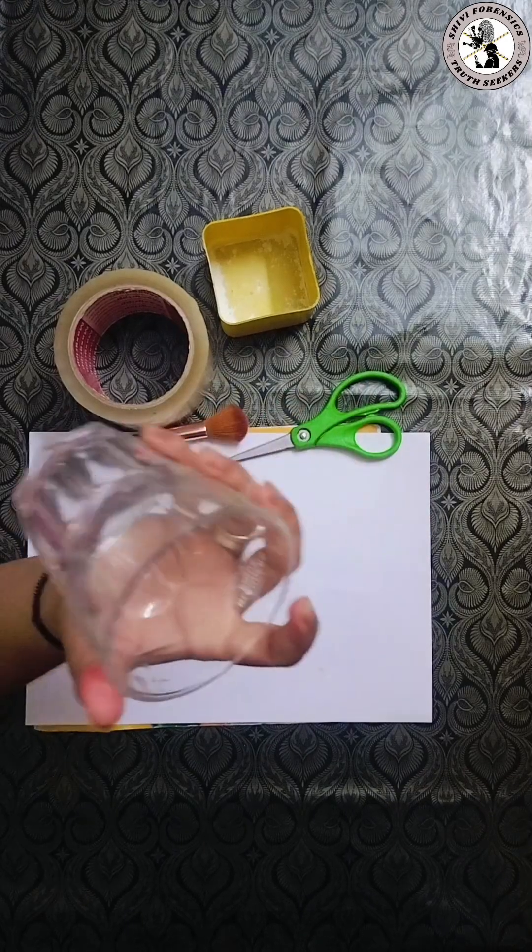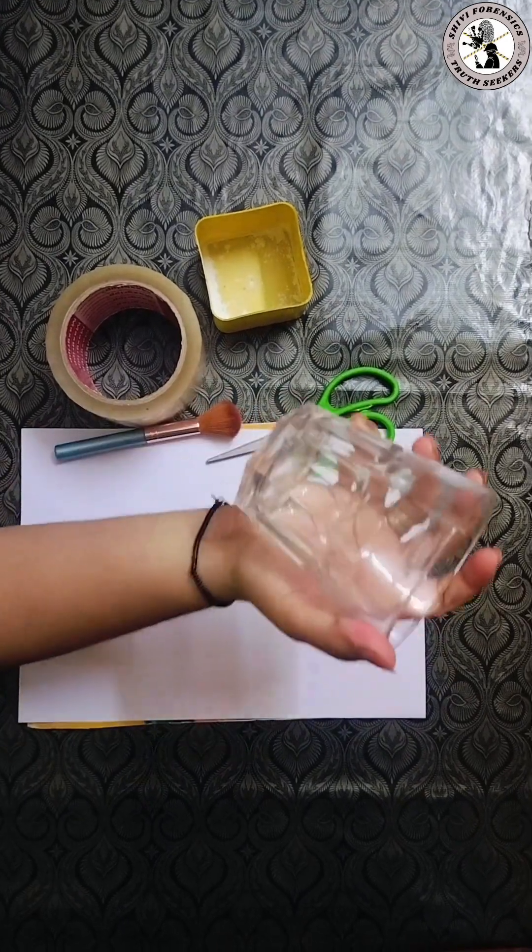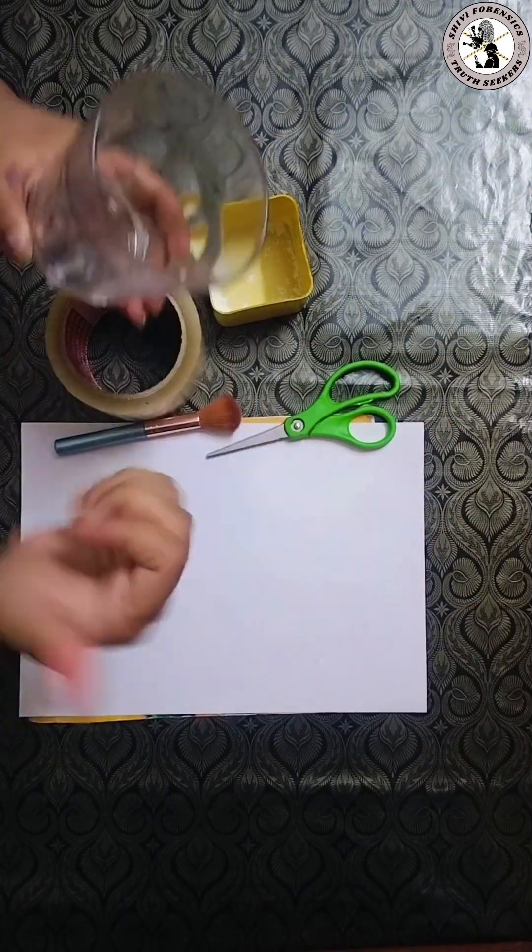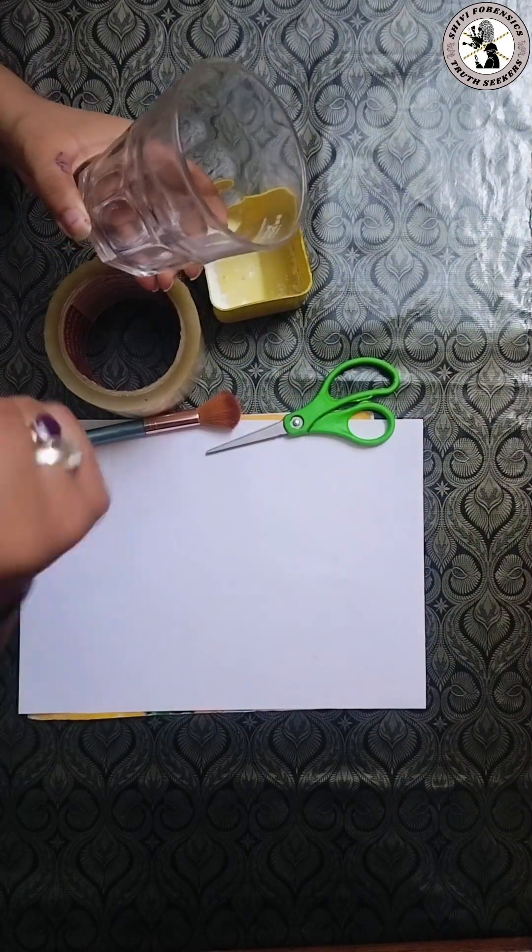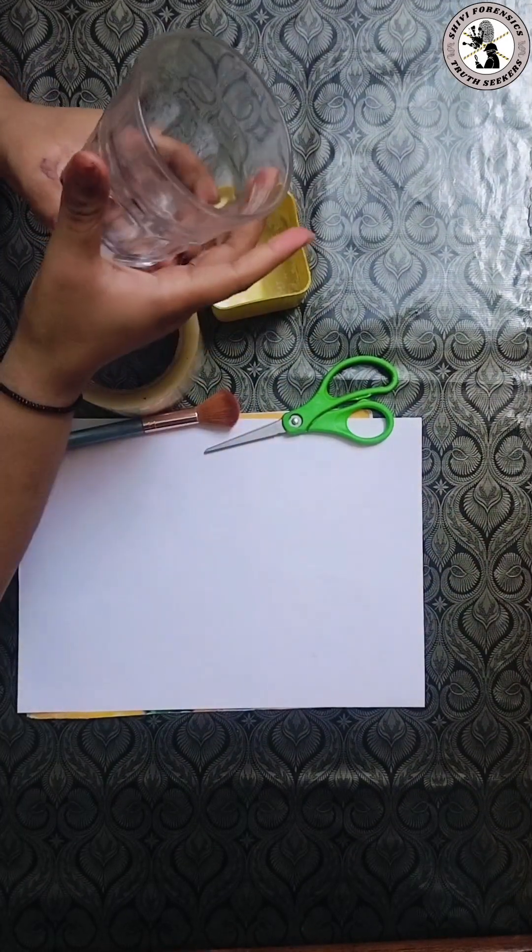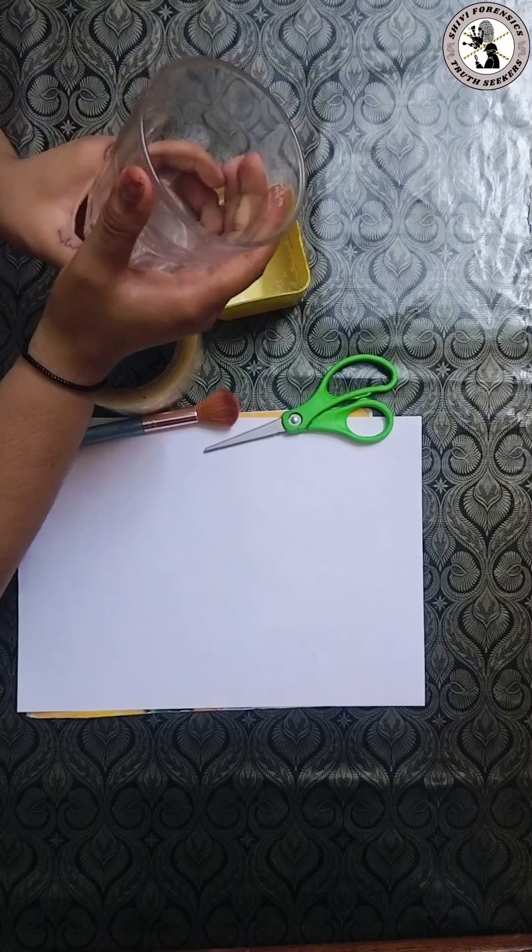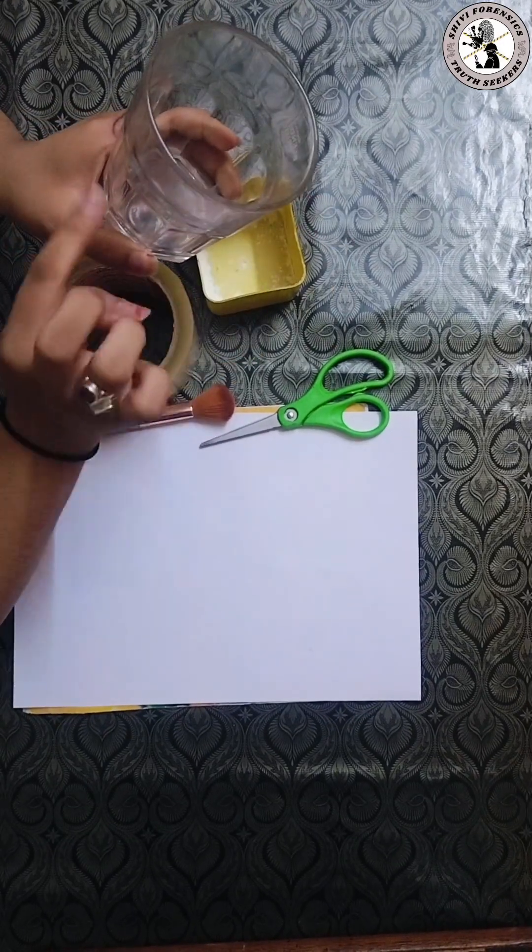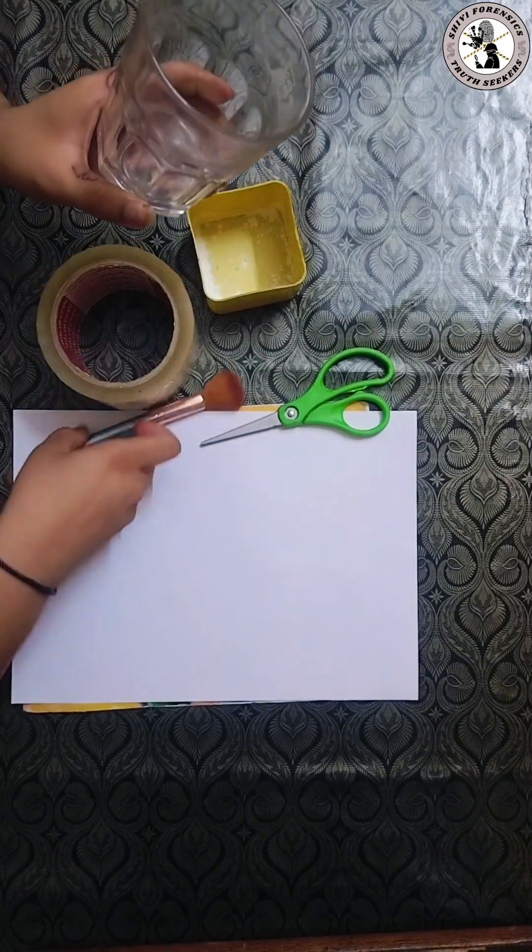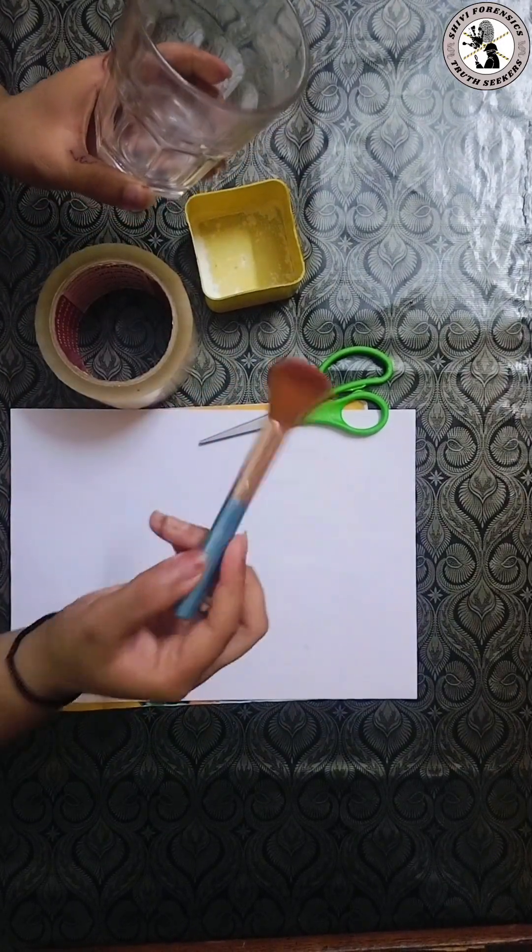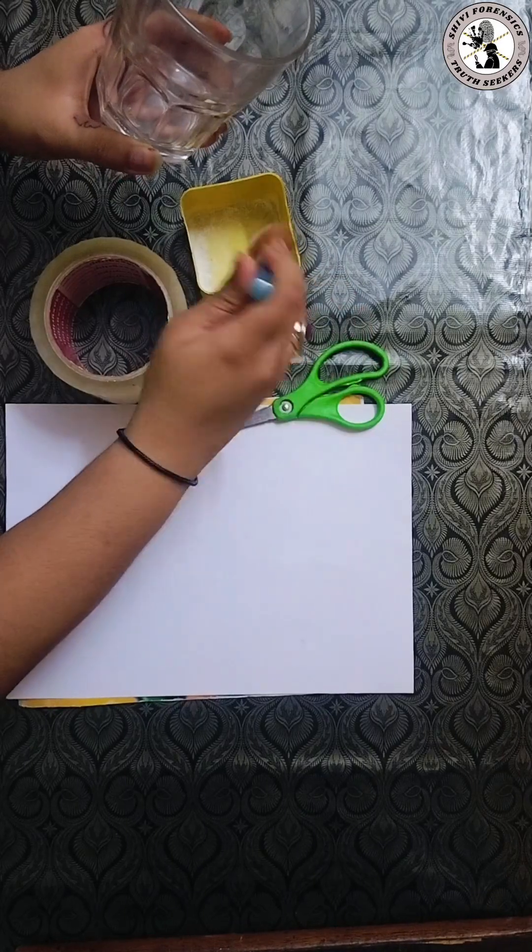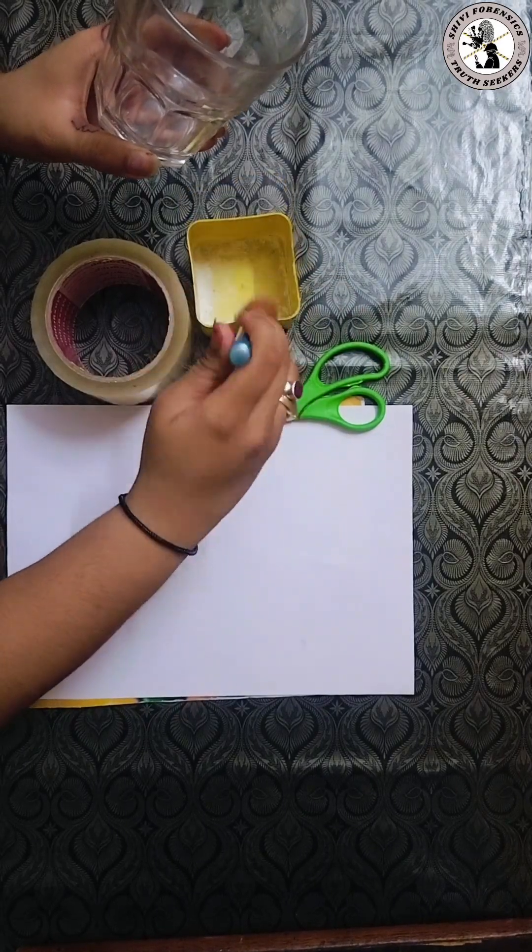I take a glass, first I touch the glass surface with a dry finger. Okay done. Now apply powder gently using a brush or cotton.